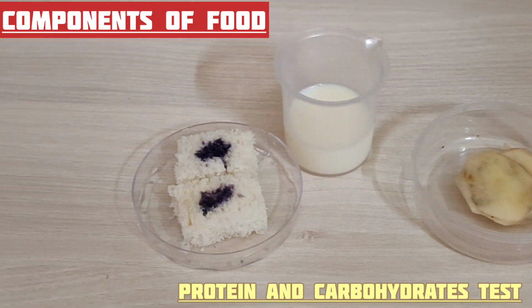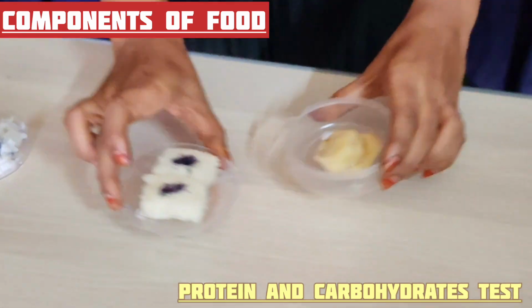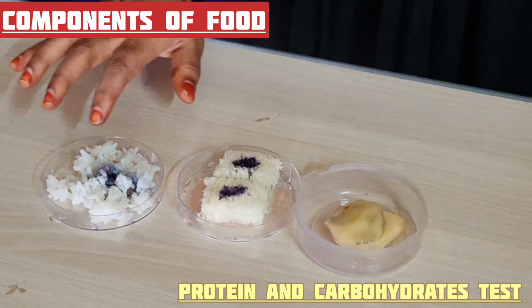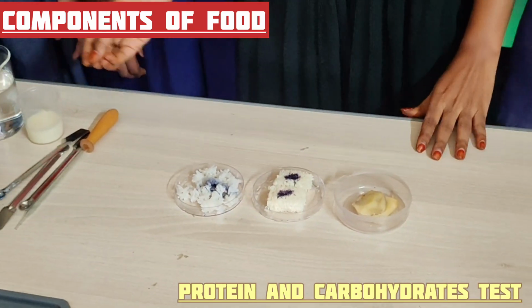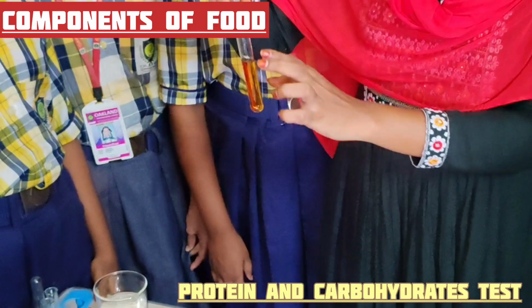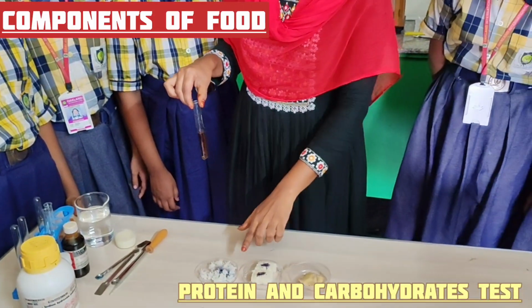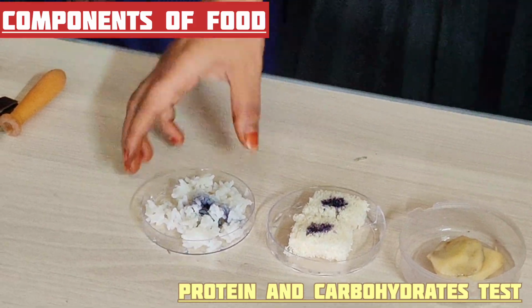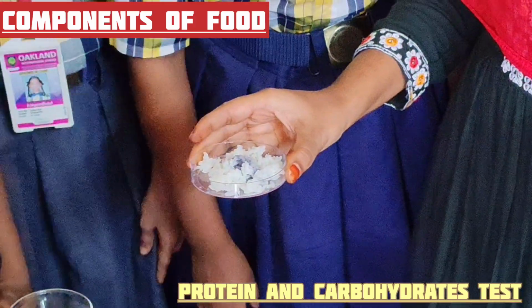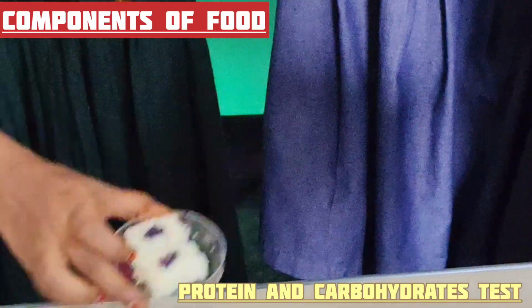Keep aside. So we can conclude that the food material which contains a high amount of carbohydrates, when we add a few drops of iodine solution to it, converts into which color? Blue. Which color are you saying? Blue black color. This bread is converted into blue black color.